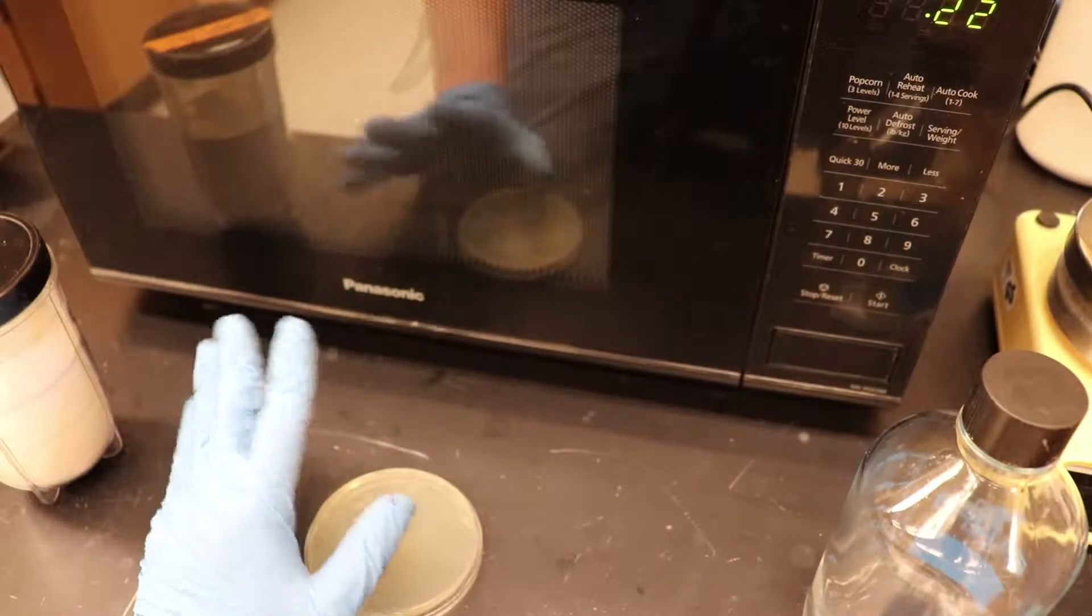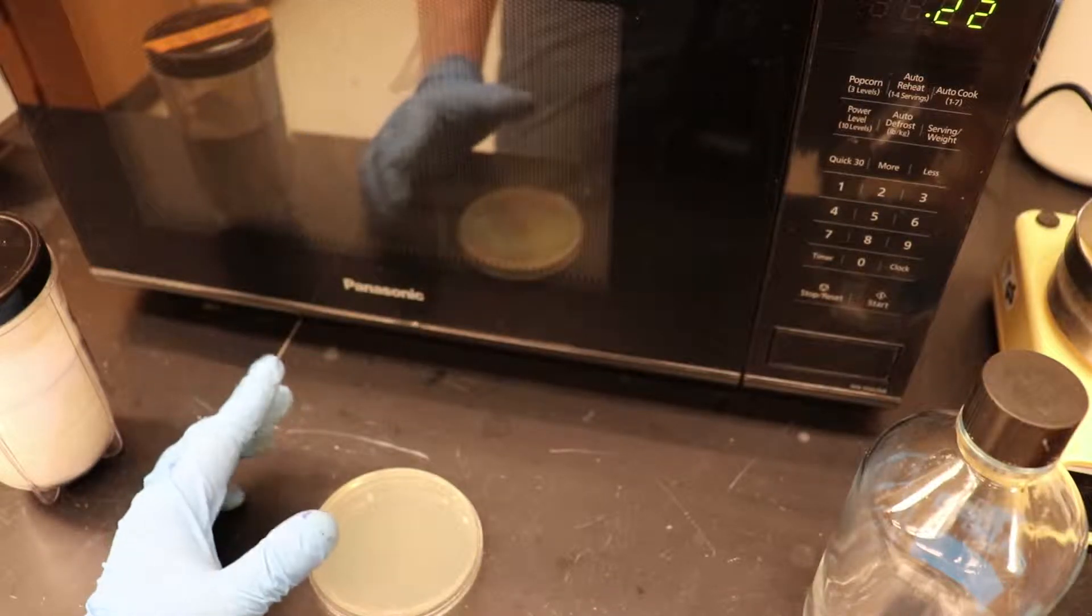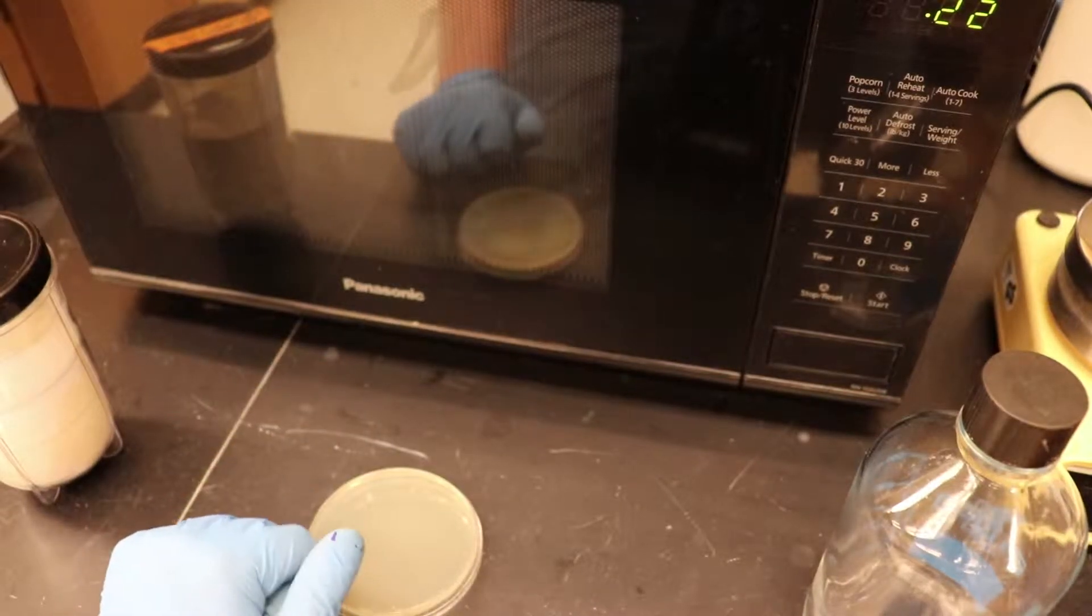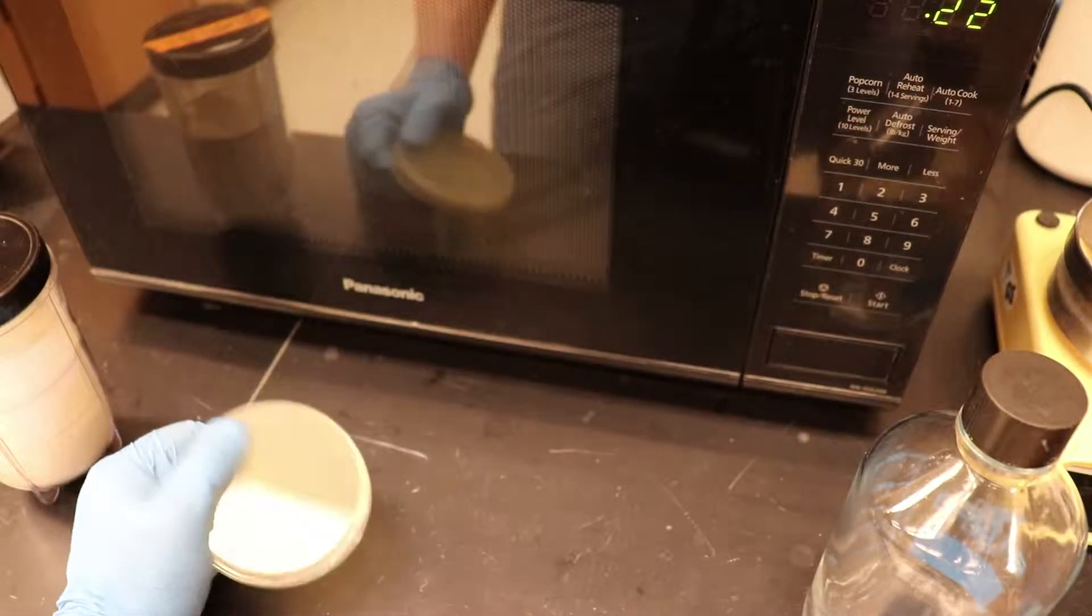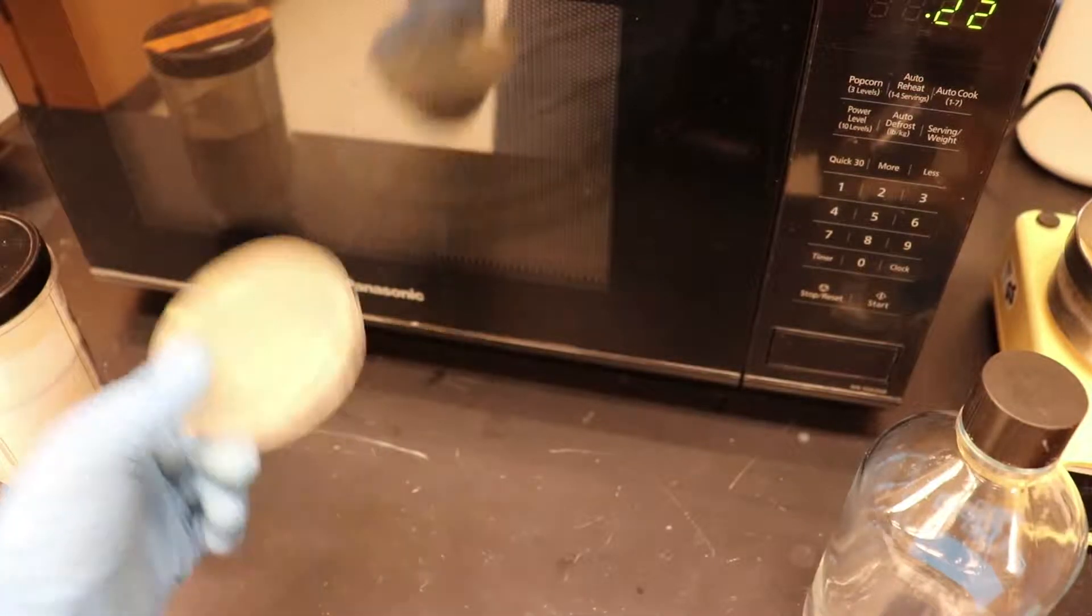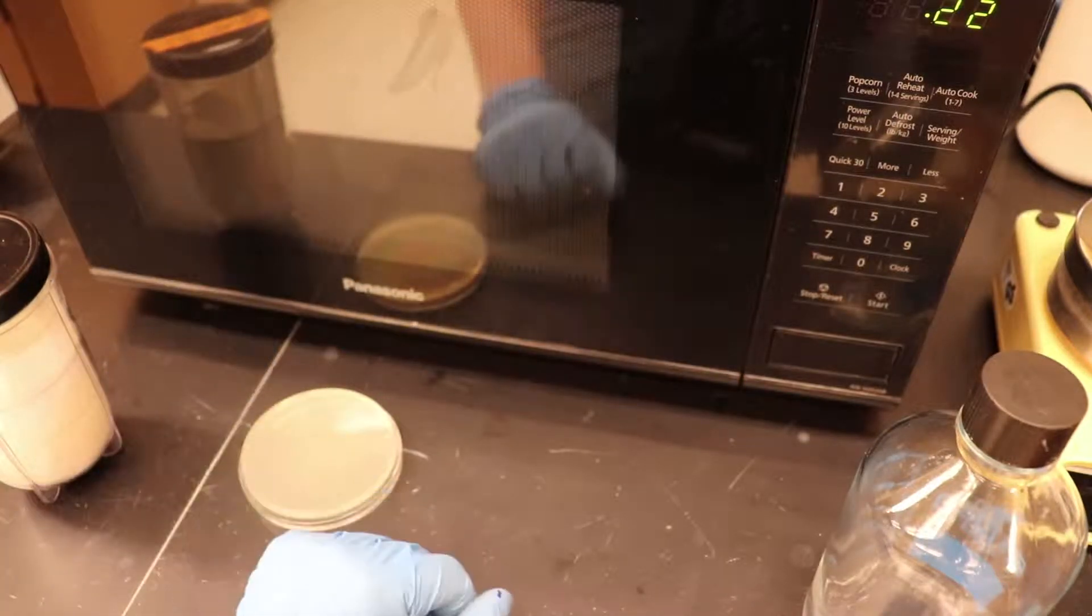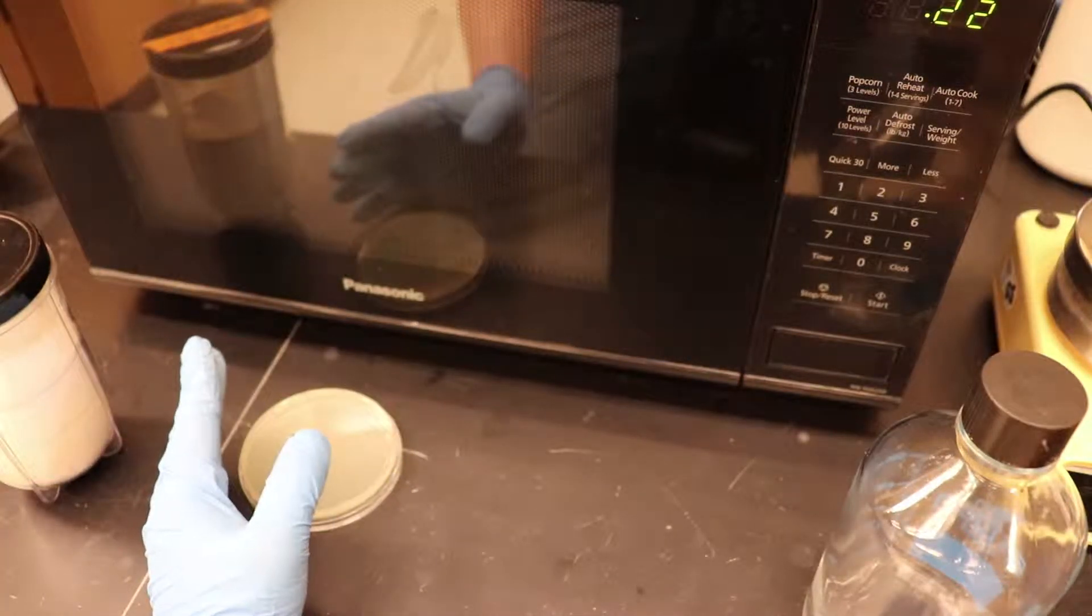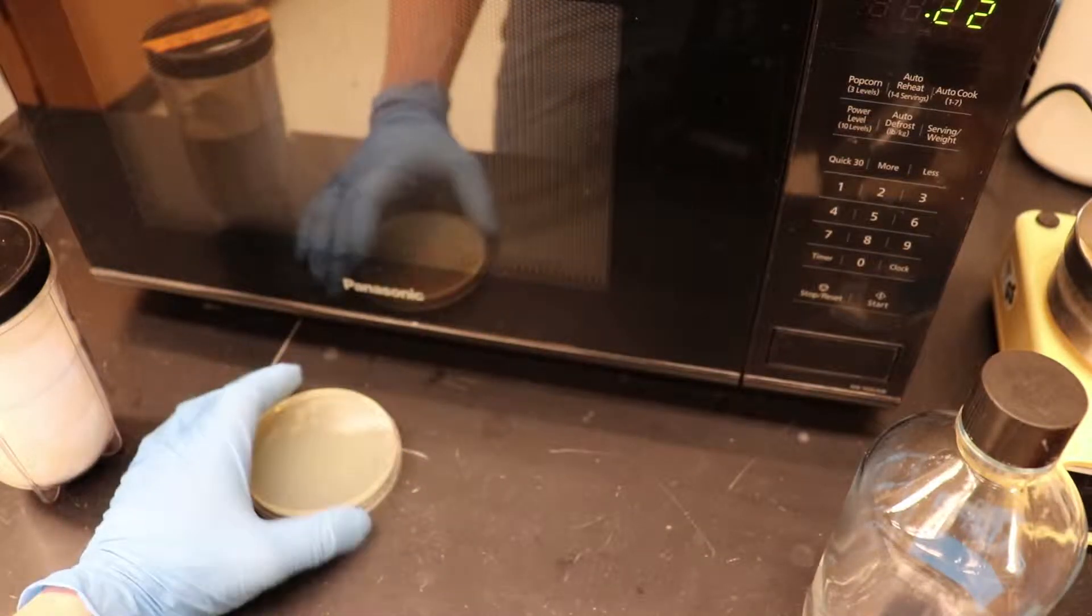Okay. So, for trick the second, let's paint a picture, okay? It's late at night in the lab, you're getting ready to plate your cells, E. coli, yeast, what have you, and you look in the fridge, and there's only one plate left. Either the person before you used all of them up, or you completely forgot to make plates that day.